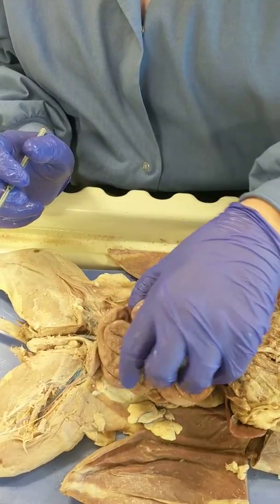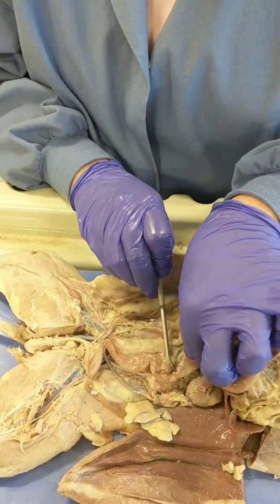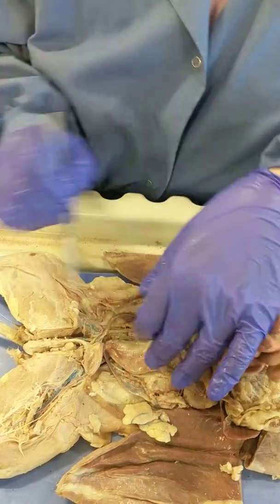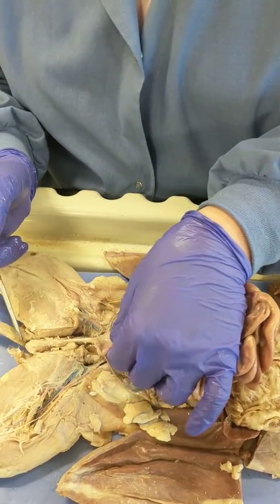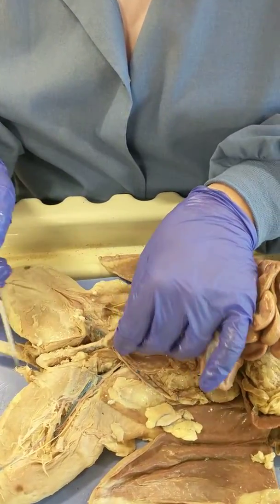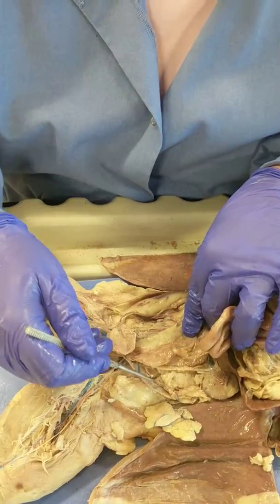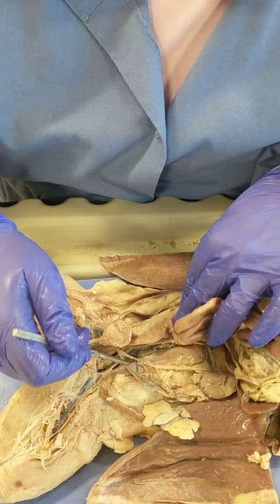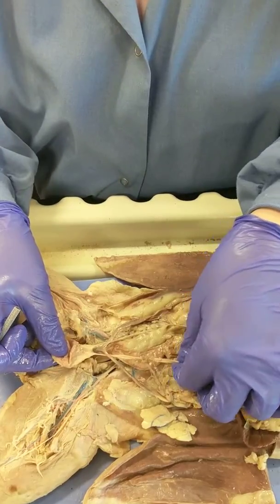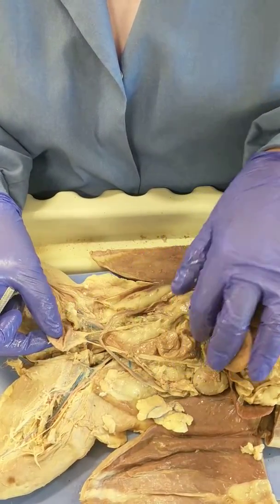Now I'm going to move the small intestine out of the way, and you can see the large intestine coming down, diving low — that's the rectum. I'll pull the urinary bladder to the side so that you can see the rectum here. So this is the urinary bladder, and here's a ureter just to get you oriented. There's a kidney, ureter, urinary bladder.